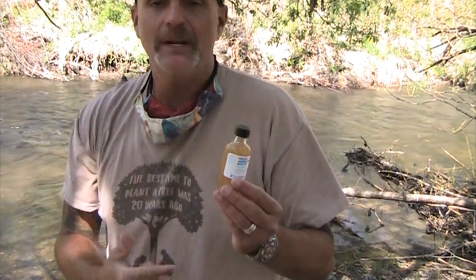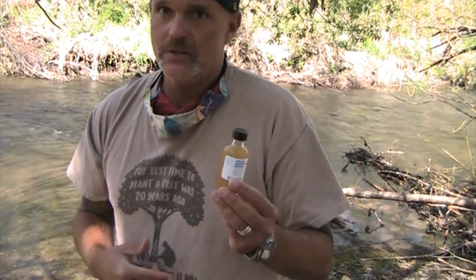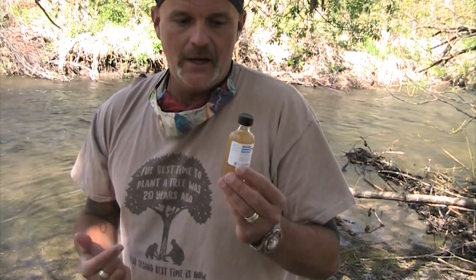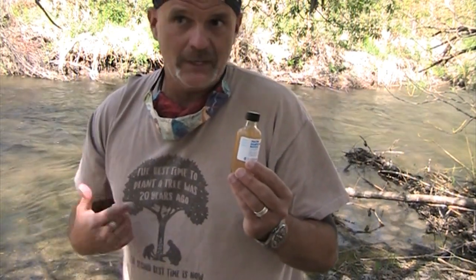At this point, the sample is actually fixed. So from this point on, you could actually do whatever you want with the bottle because it's not going to change. You've stopped all the science. What we've done is we've bonded iodine indirectly with oxygen. At this point, if they warm the bottle by putting it in their pocket or by putting it in a backpack to take it back to school, its dissolved oxygen is not going to go bad. If little Timmy or Jeff, who keeps killing houseplants, can't help himself and keeps shaking it, it's not going to change it now.